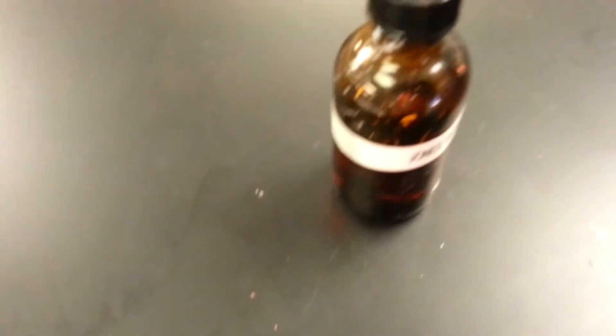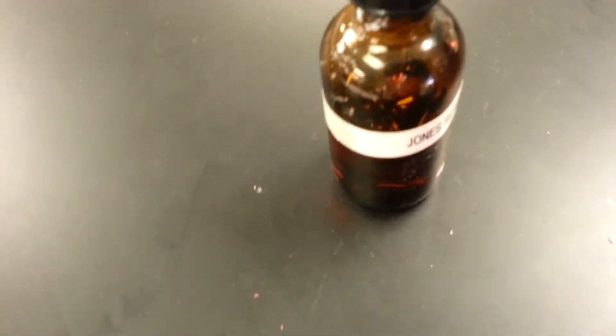I do recommend highly that you look up what the test for and everything. Jones Reagent, you'd have to use the Tollens, which doesn't look like I took out, but I'll get it out since I have to pause all this anyways. But this is the Jones Reagent.